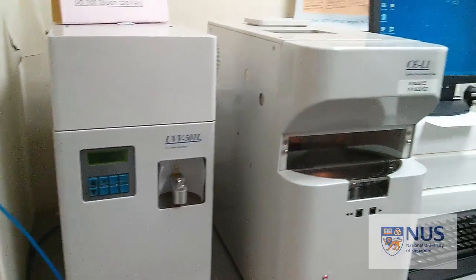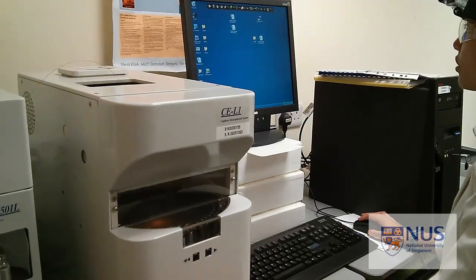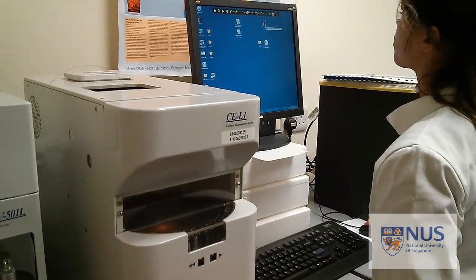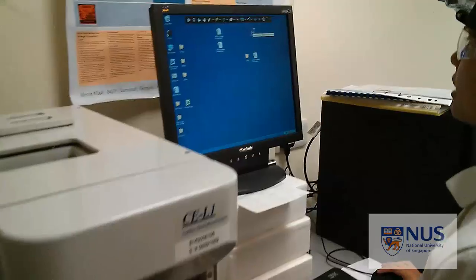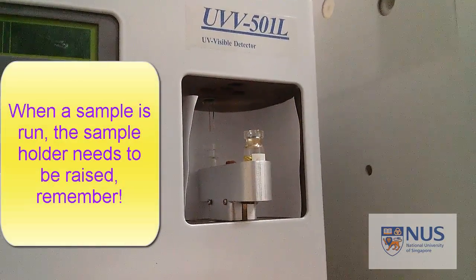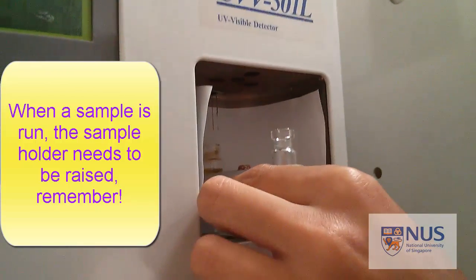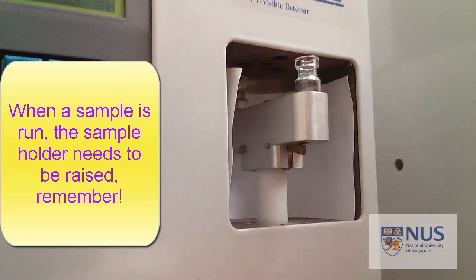So to start with, we need to wash the capillary tube to make sure that it's clean and ready for us to use. The software we're using is CE Station 9599. So just open this one. Okay, so let's just walk through this.